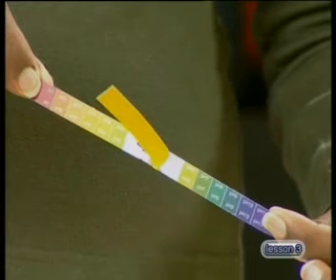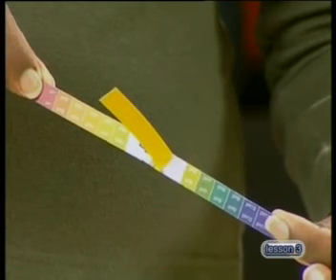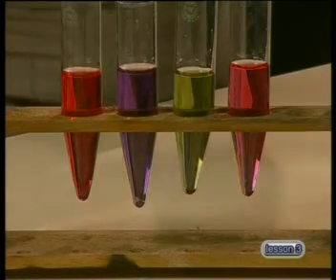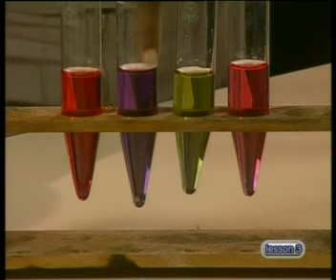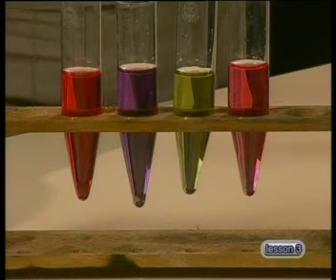The best thing about universal indicator is that it links directly to the pH scale. So we can use the paper or the liquid indicator, check the colour, and read off the pH from the indicator. Let's use this indicator to test our original solutions from lesson 1. We showed you that these solutions were acids and that this was a base, but now we can see how acidic or basic each substance is.